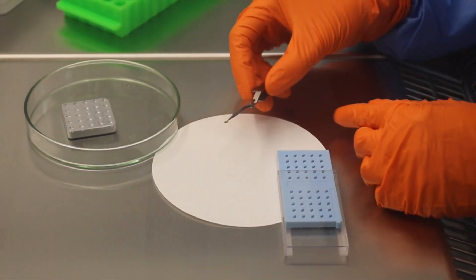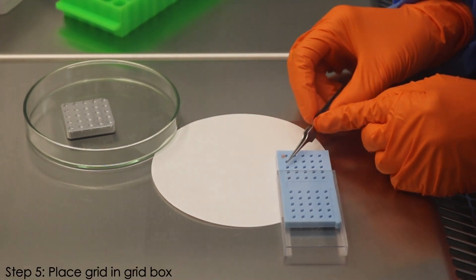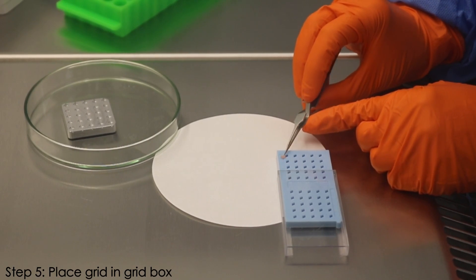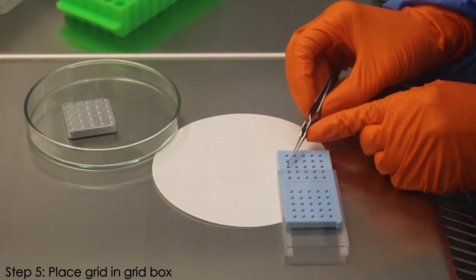Finally, place the grid in a grid box until you are ready for imaging. Due to the flow in the biosafety cabinet, be careful to keep the grid from flying away.